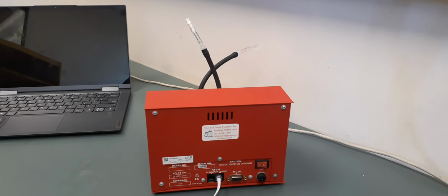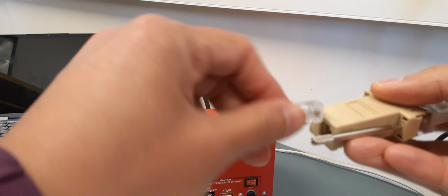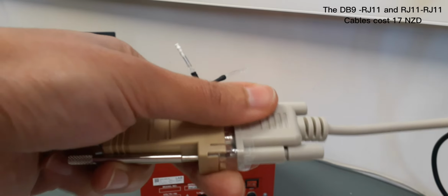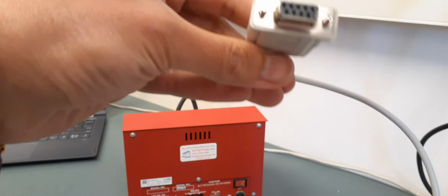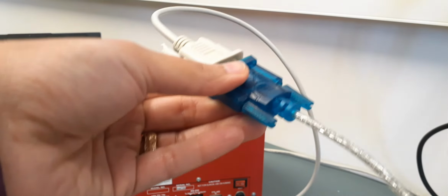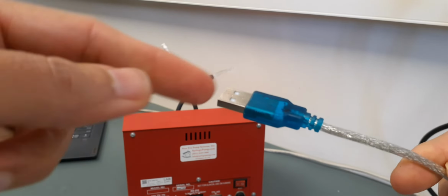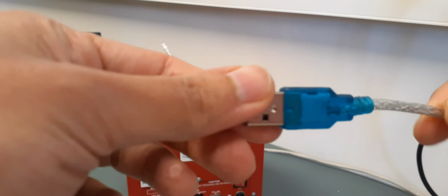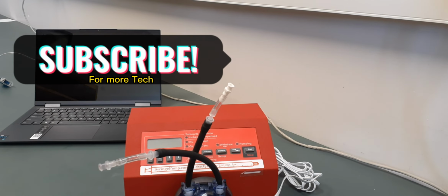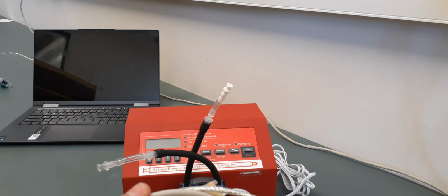So as I said, the cable goes to the pump, and then to our DB9 adapter, and then to this extension cable, which is changing the gender. I felt it's not really secure, so I taped it, and then another end of it, which is the same as the other side, we will connect to this. You can secure this one as well, and then you can connect this to the USB port on your computer. I am going to use this pump in a LabVIEW program.